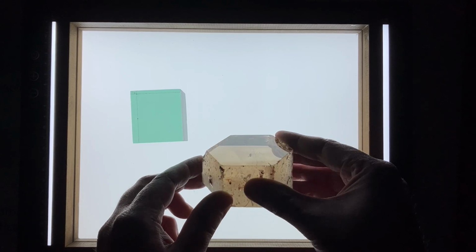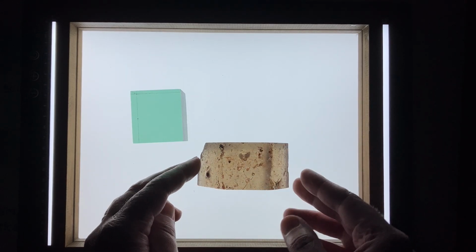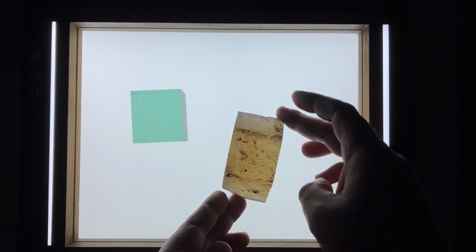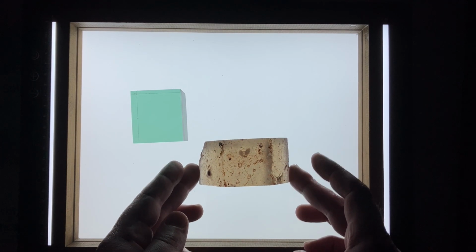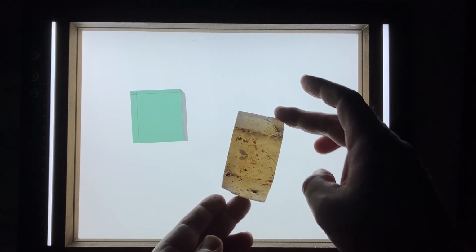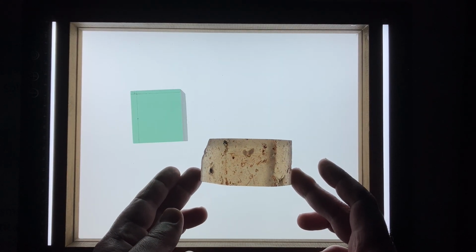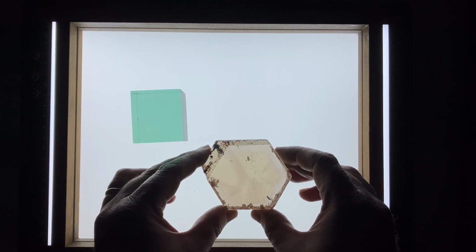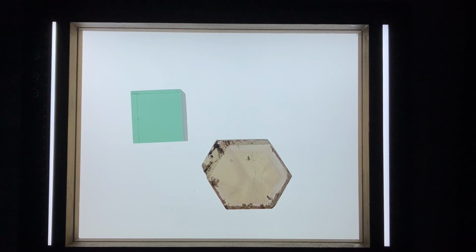When we change our view to looking along the plane of the A crystallographic axis, you'll notice the quartz changes color as we rotate. It goes from like a pale straw yellow to a much darker yellow. Now this is a pretty mild demonstration of pleochroism, but part of that is because of the color saturation of our crystal. If our crystal were darker, the pleochroism would actually show up a bit better as well.